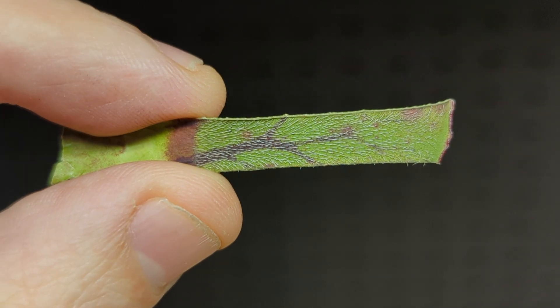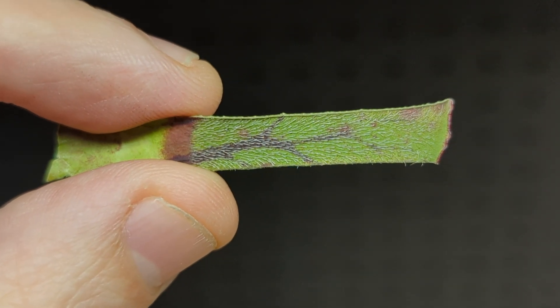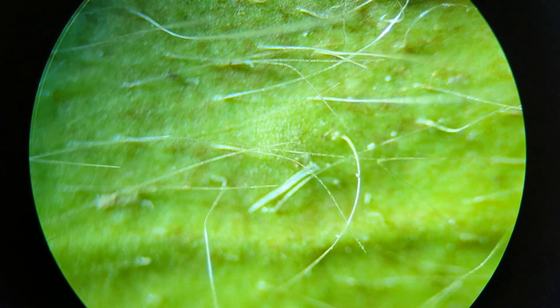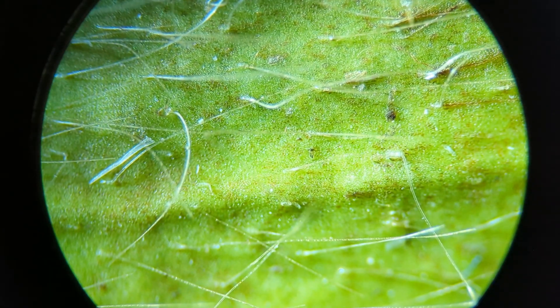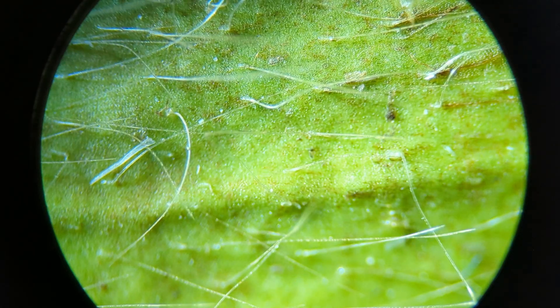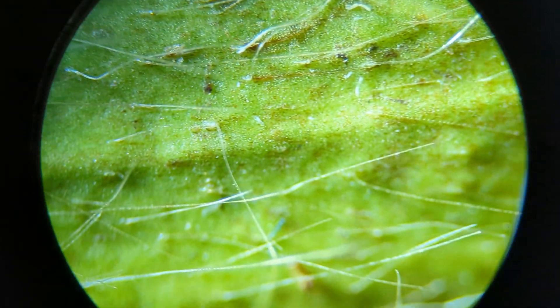Here I'm looking at the downward-facing teeth on the top of the plant — we've looked at these before. Their function has been written about a lot; they just make bugs slip pretty easily. But here we also have the hairs from the detentive zone. It's been called the detentive zone as if the hairs' purpose is to detain insects, but of course that can't be the case — they're already going to be dead and won't be trying to escape.